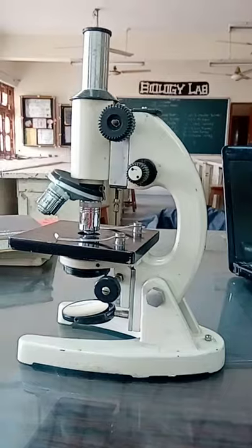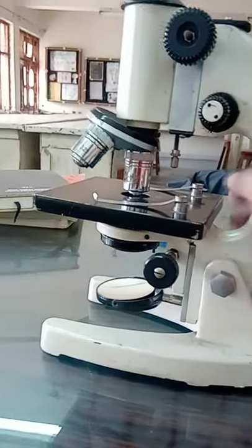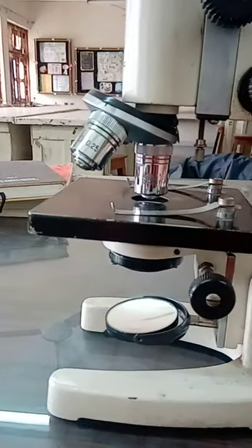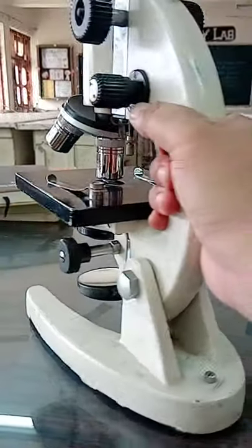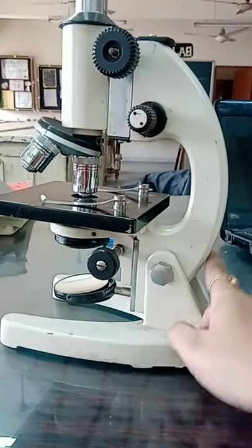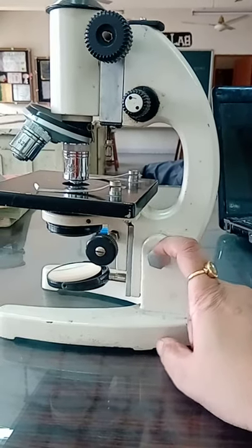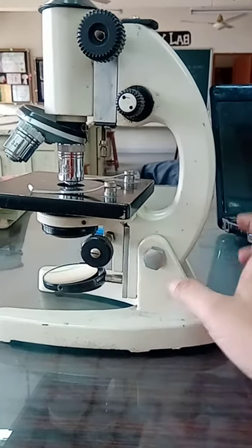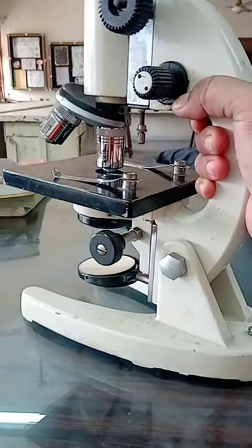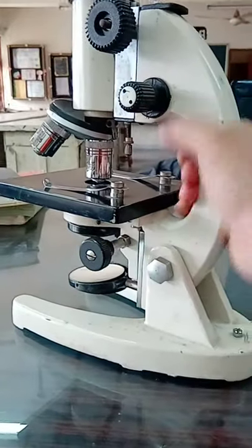The mechanical parts include: number one, the base or foot, which is horseshoe-shaped. It is just like the stand of the microscope. The base is attached to the curved arm of the microscope at a point which is called the inclination point. At this inclination point, we can bend the upper body of the microscope as per our comfort.